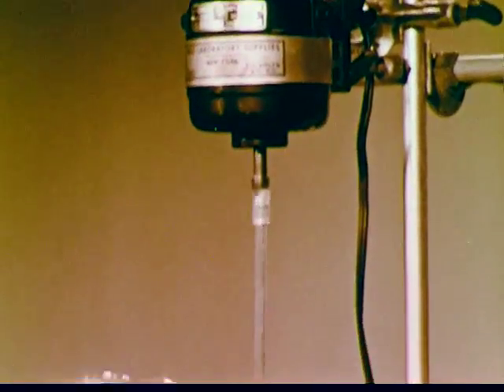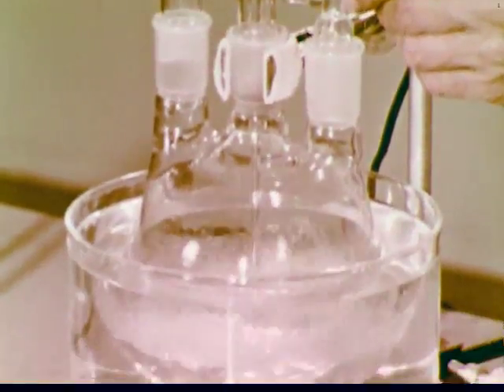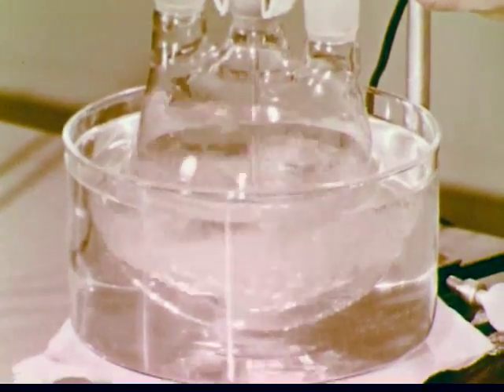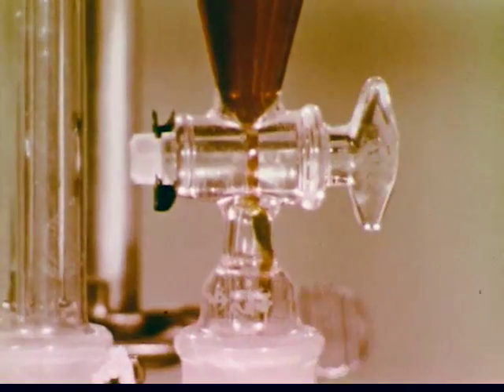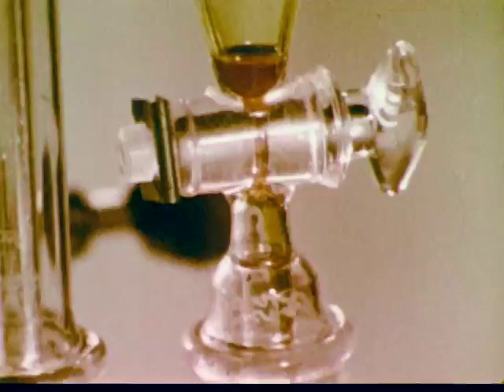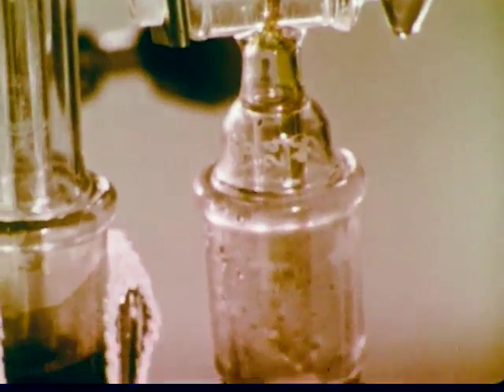Ether and water do not dissolve in one another; however, vigorous stirring assures that the two solutions will be in contact so reaction can occur. The dichromate solution is added to the flask at a controlled rate. During the oxidation, heat is released, which is absorbed by the water bath surrounding the reaction flask. As the reaction nears completion, the orange dichromate ion has been reduced to green chromic ion. The actual synthesis is now completed.